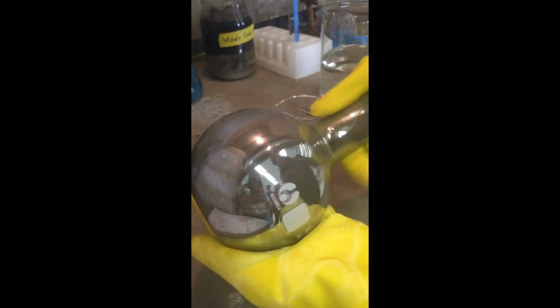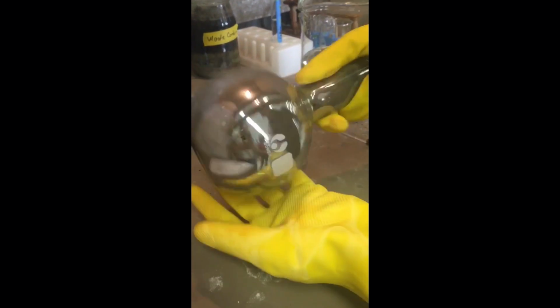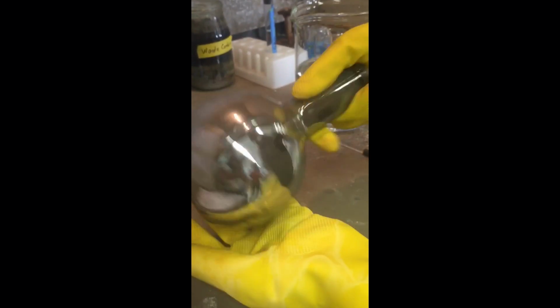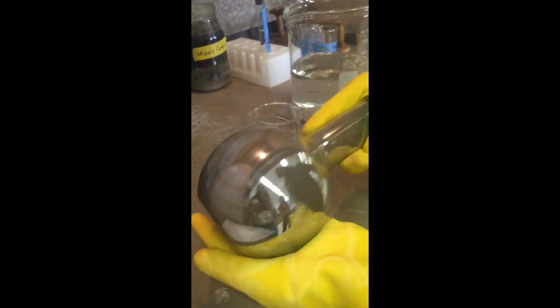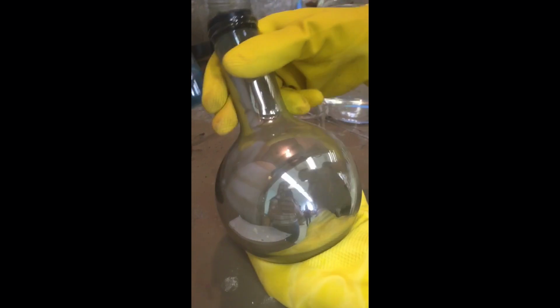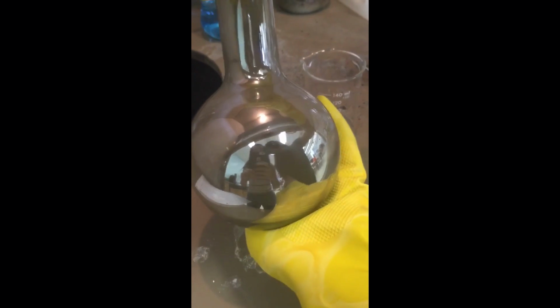I know, but you mixed it super fast. It was like silver. It's like silver nitrate, silver from solution. Yeah. I can stop and just... we're going to just slowly turn it.